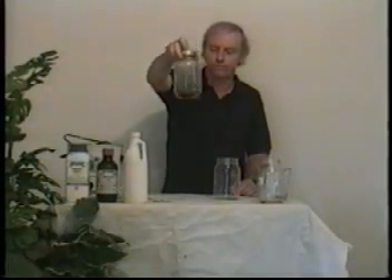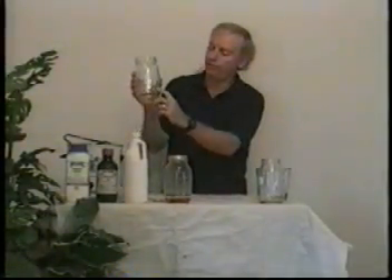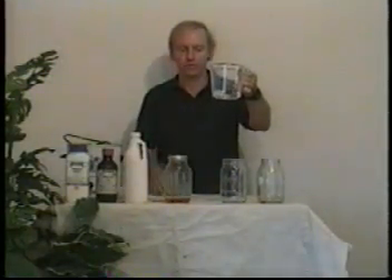You can see that's enough to dissolve a one-third of a gold leaf coin. Now on bottles you find different measurements, but a measuring cup, just for making solutions, is very good. But make sure you've got twice as much muriatic acid as nitric acid.